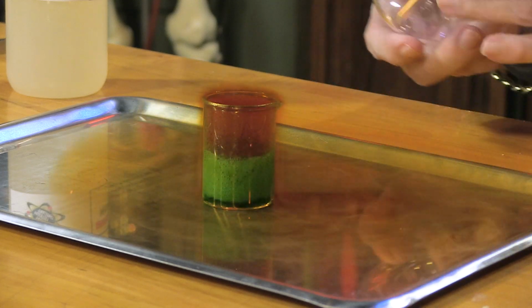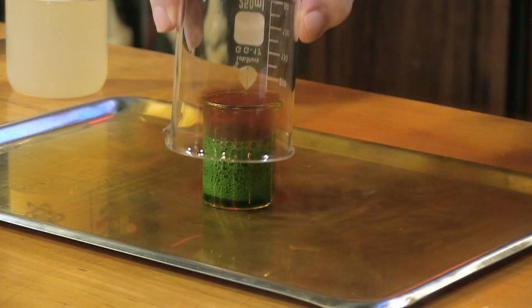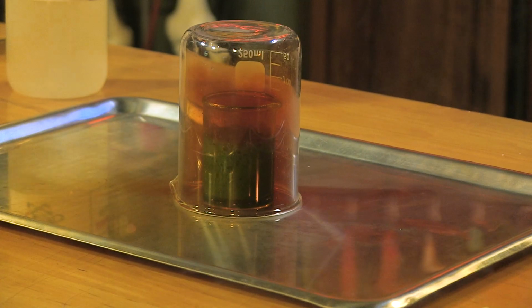Oh, I'm getting gas. I'm getting gas. Hooey! That's nitrogen dioxide, and that's deadly. If I would inhale enough of that, it would get into my lungs, dissolve in the liquid in my lungs, and recreate that nitric acid.